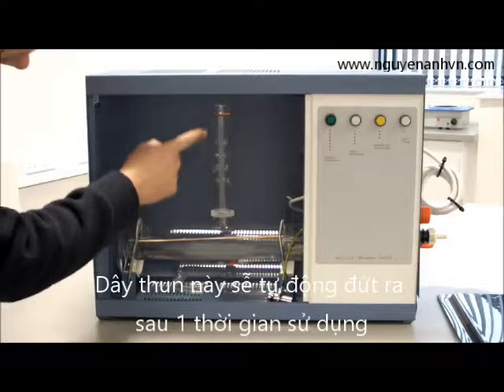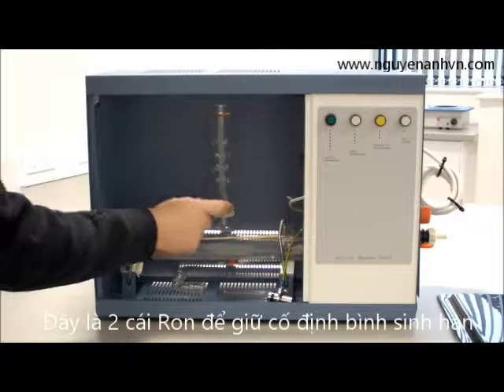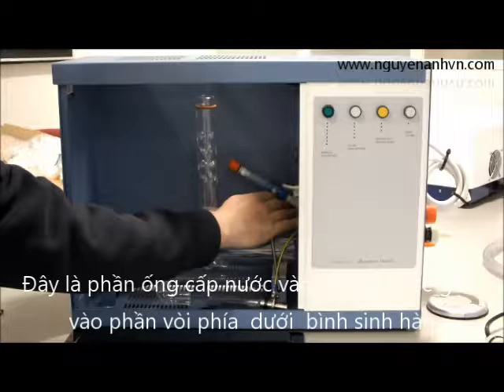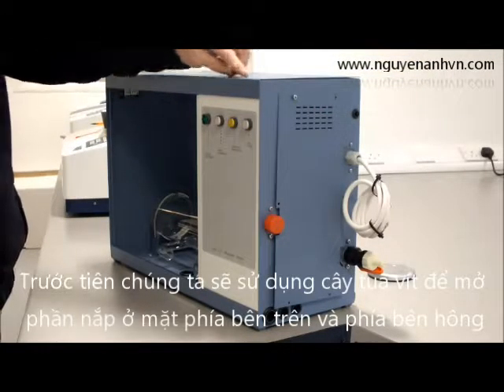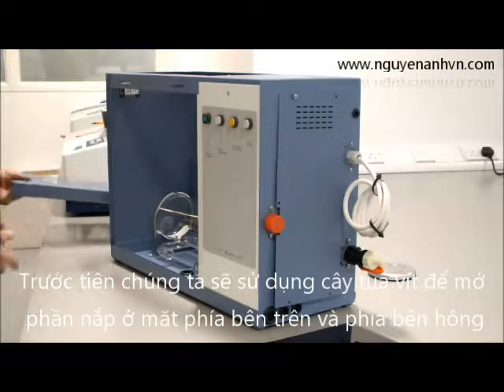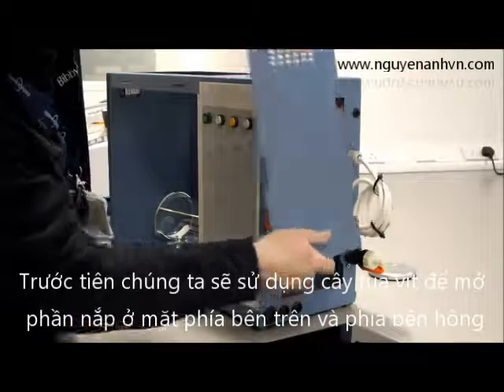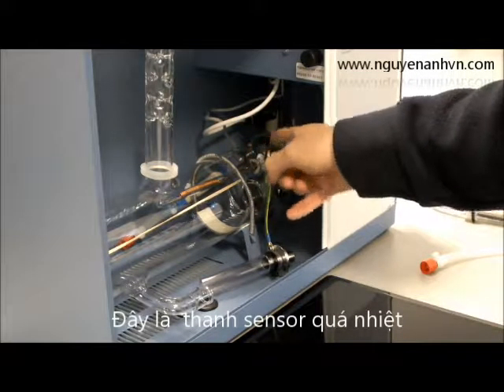On the boiler itself we have an O-ring and a sealing ring. Just make sure they are fitted before we begin to assemble the condenser. At the back we have the water flow control, which we will be assembling shortly. We also need to remove the lid, which consists of six countersunk screws. When they are removed, the lid is taken off. There are also six screws for the side panel, which can then be removed. We have the thermostat glass tube which runs inside the boiler, and inside there we have the thermostat itself.